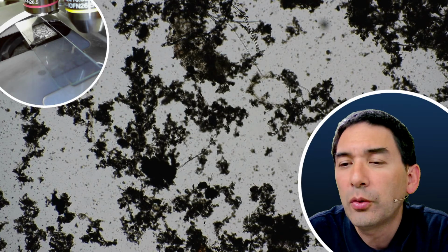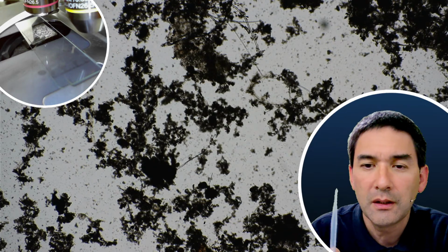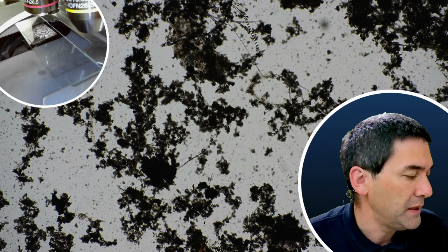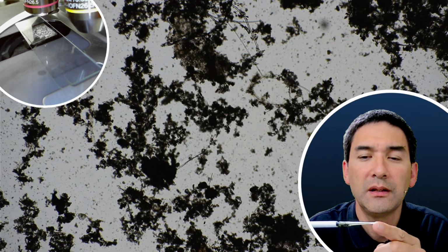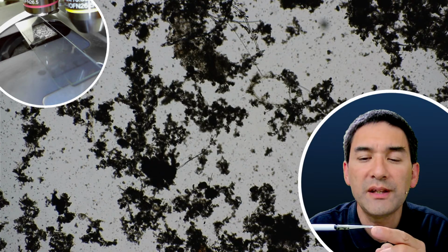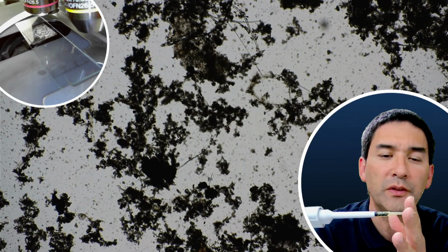I'm going to, again, another question. I'm going to try the pipette method to break up the dirt. By the way, these are disposable pipettes. I bought a pack of 100. Another pipette that I have are those microliter pipettes. You can also use those, but the tip is a little bit too narrow. So if you want to use those, they're a little bit more convenient maybe, I would take a scissor and cut off the tip to make it a little bit wider.